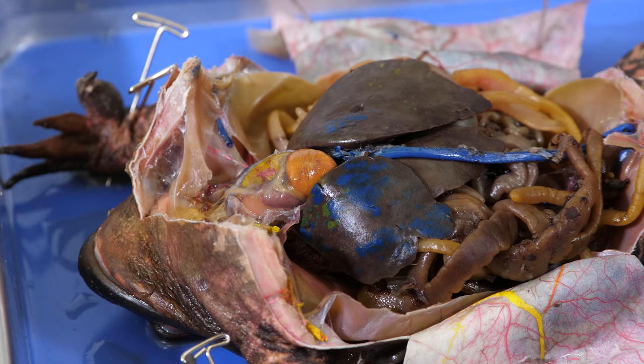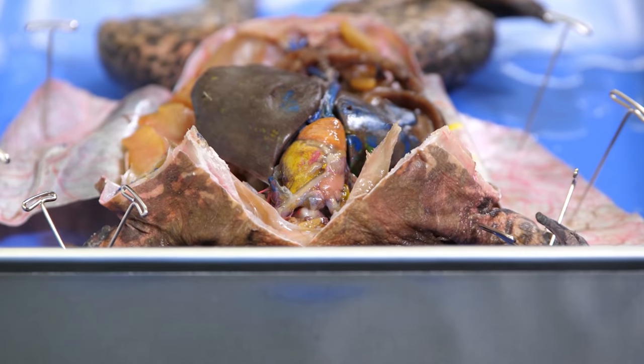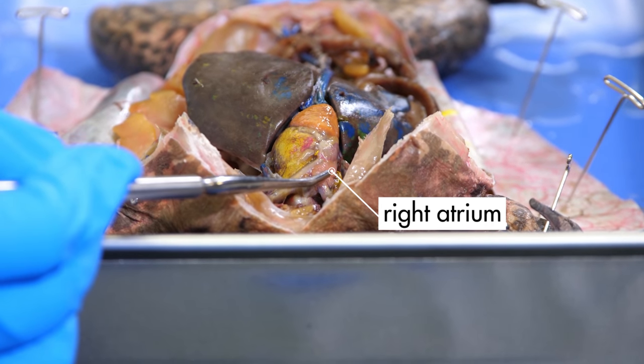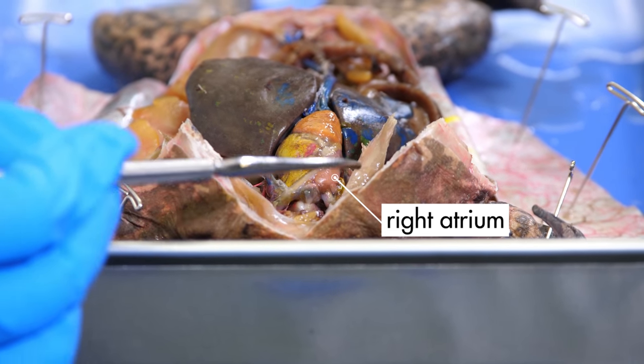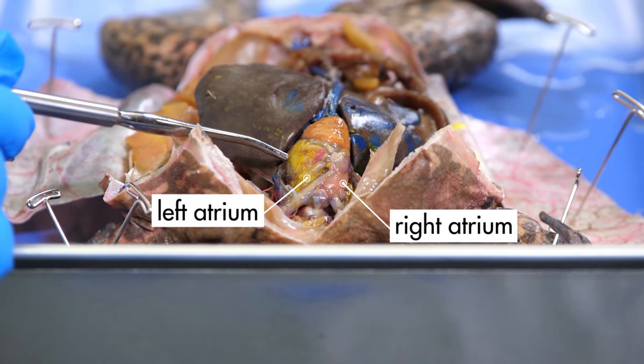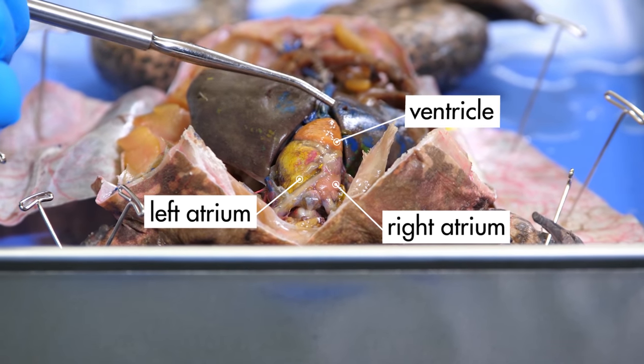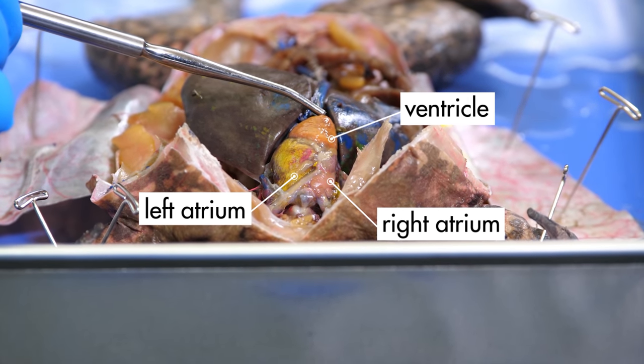We need to open up the pericardium to see the parts of the heart. Now that the pericardium is opened up, we can see the chambers of the heart. A frog's heart has three chambers: a right atrium, a left atrium, and a ventricle.